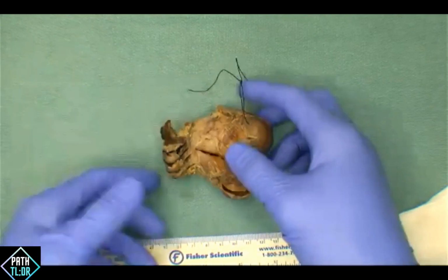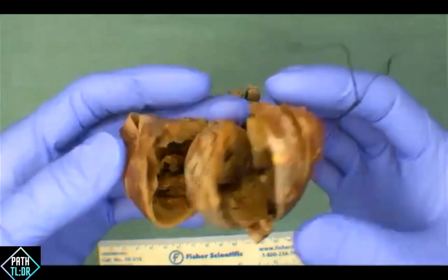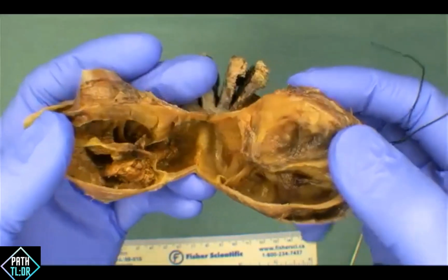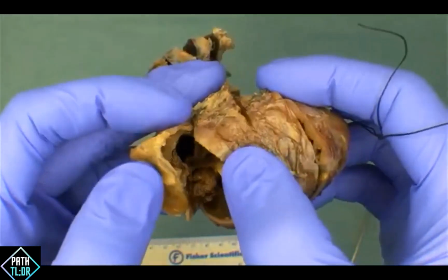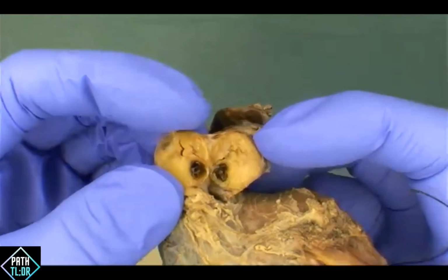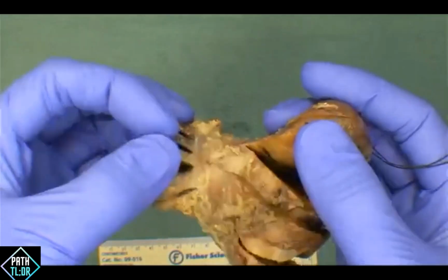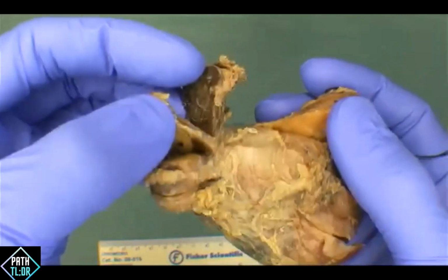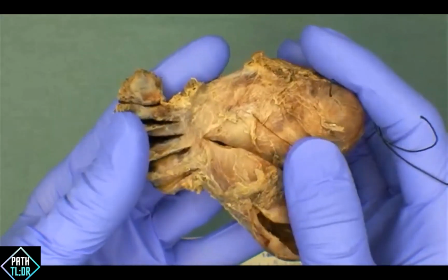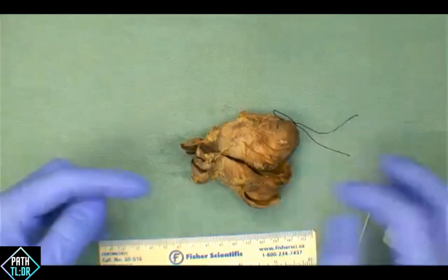And then as you go into your description, looking at your pathologies, we've got one dominant mass here occupying the majority of the right lobe. We'll talk about what that looks like, its contents, and using a lot of the great descriptors we've offered in the chat. We'll also include some detail about the other nodule in the inferior pole of the left lobe, commenting on its cut surface and some of the background thyroid parenchyma as well. On any thyroid gland, you always want to be mindful and look for parathyroid glands that are sitting on the back of the thyroid. Generally speaking, we don't often see them, but you do want to be aware that they could exist there as well.